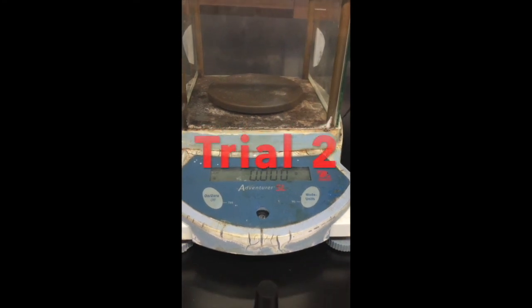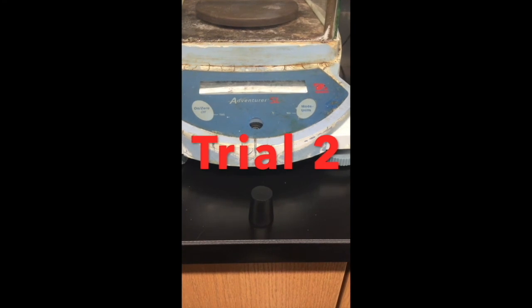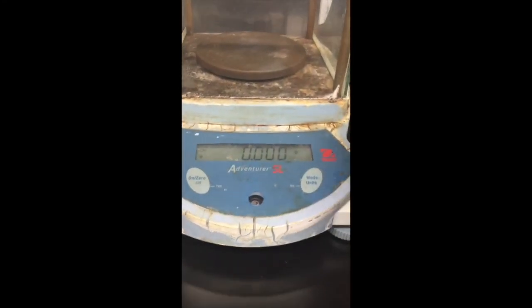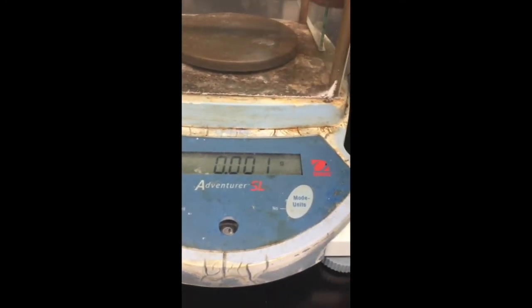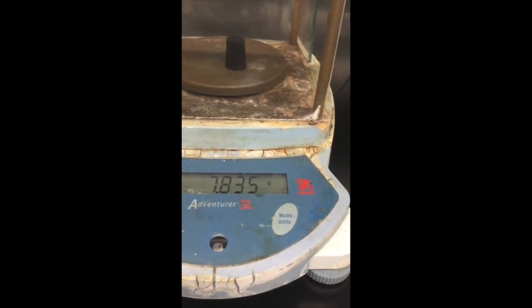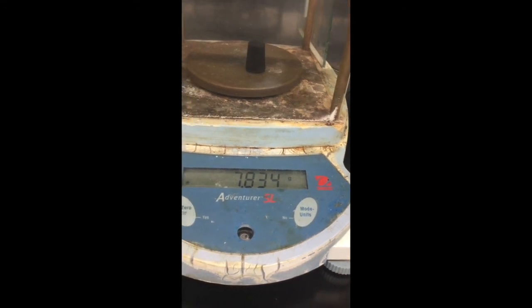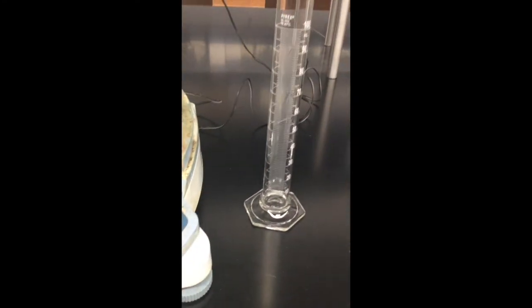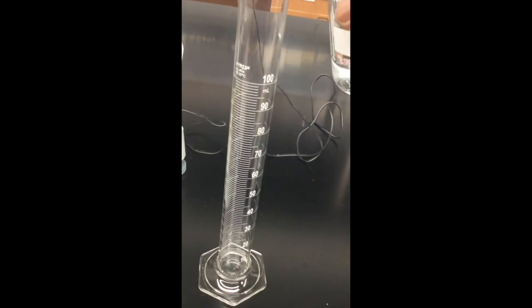For trial 2, you will record the mass of rubber stopper number 2 using the milligram balance. You'll record the mass using 3 decimal places, or the milligram. That is the mass of rubber stopper number 2, trial 2. Next, I will fill the second graduated cylinder with deionized water.